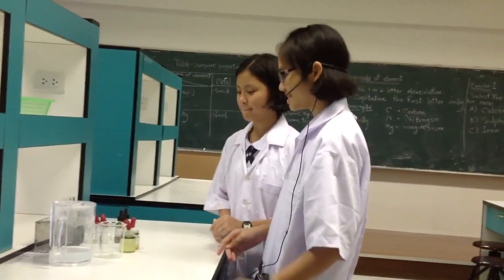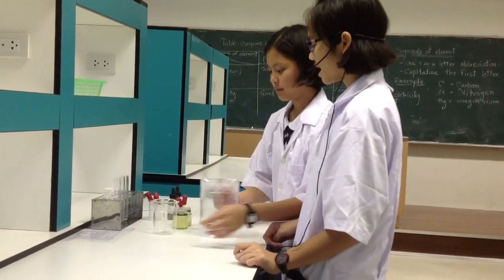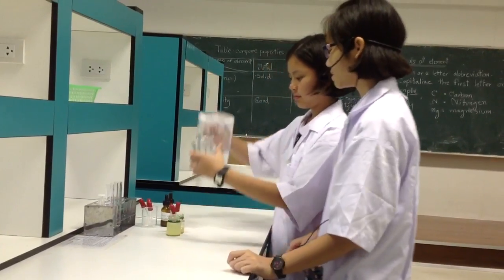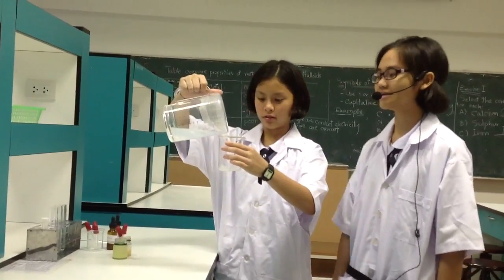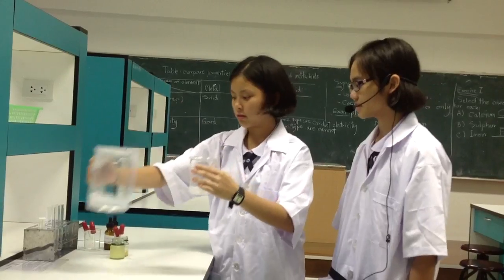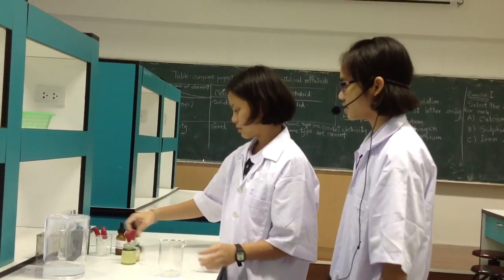Proceed to the first step. Add 14 cubic centimeters of starch solution into the beaker.